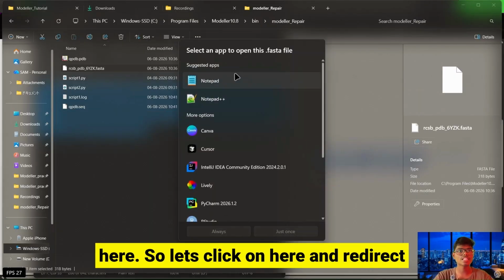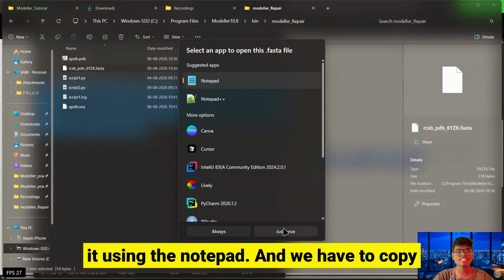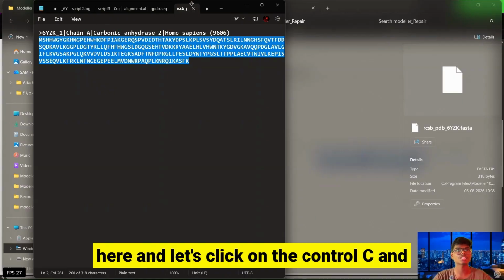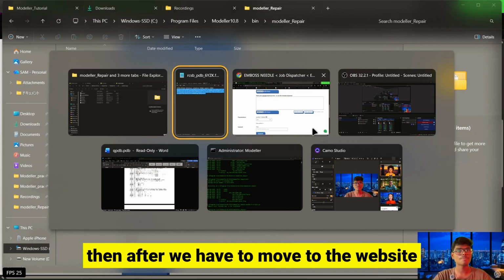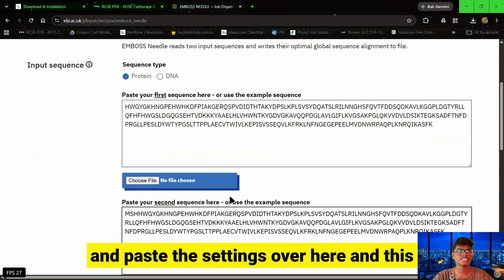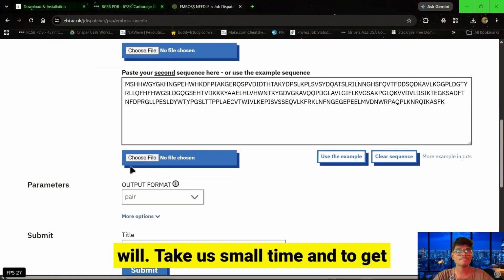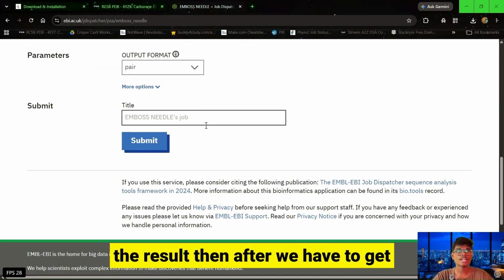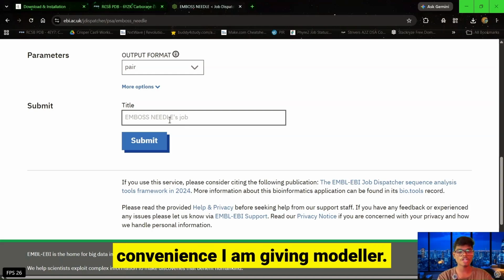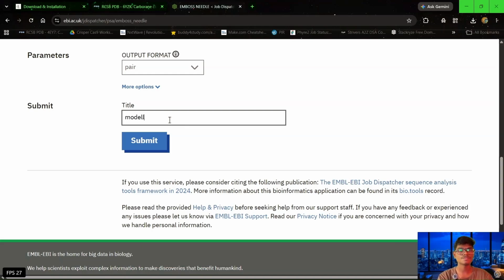So let's click on here and open it using Notepad, and we have to copy the content of the sequence from here to here. Let's press Ctrl+C, and then we have to move to the website and paste the sequence over here, and this will take a small time to get the result. Then we have to give a title for this. For my own convenience, I am naming it modeller sequence.